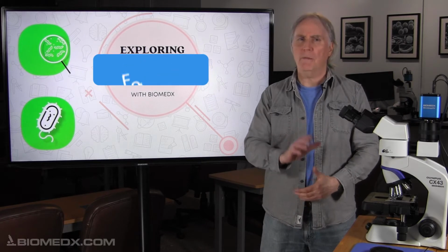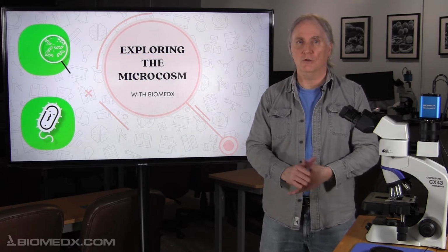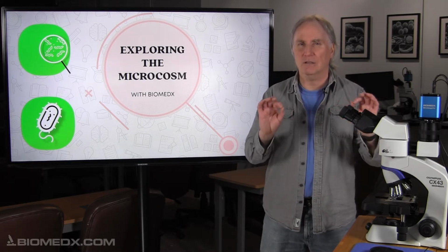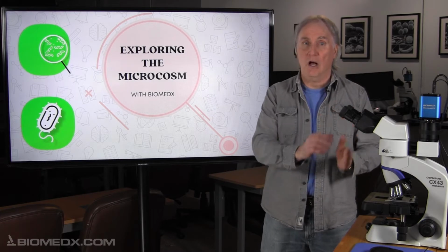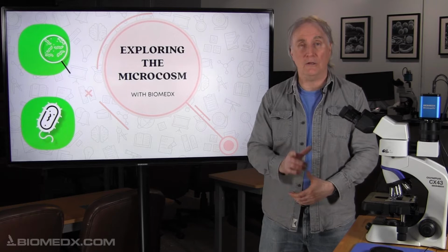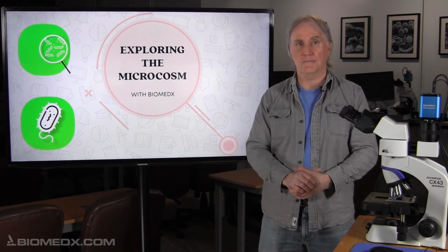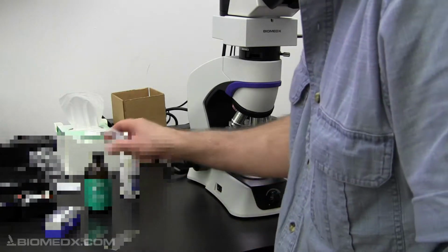So a while back, I had a request from someone that wanted to look at the liposomes in the liposomal glutathione. I checked it out and there wasn't a liposome to be found in the product at all. So I did a video showing them that product along with a product that I had tested years before for a manufacturer that I knew had good liposomes. Let's take a look. Okay, we're going to be looking for liposomes in this product here.